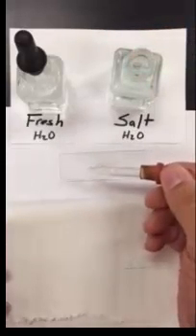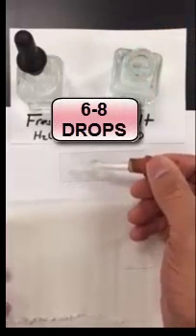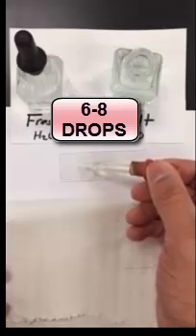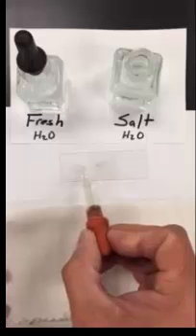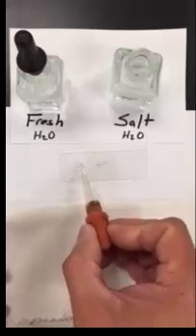You need to take your salt solution, fill up the dropper, pick up the bottle and you're going to put drops on the left side of your cover slip here. Not on the cover slip but on the microscope slide next to the cover slip. It is okay for the water to touch the edge of the cover slip because that's what we want. So you want to put it as close to the cover slip as possible. So I'm going to do one, two, three, four.